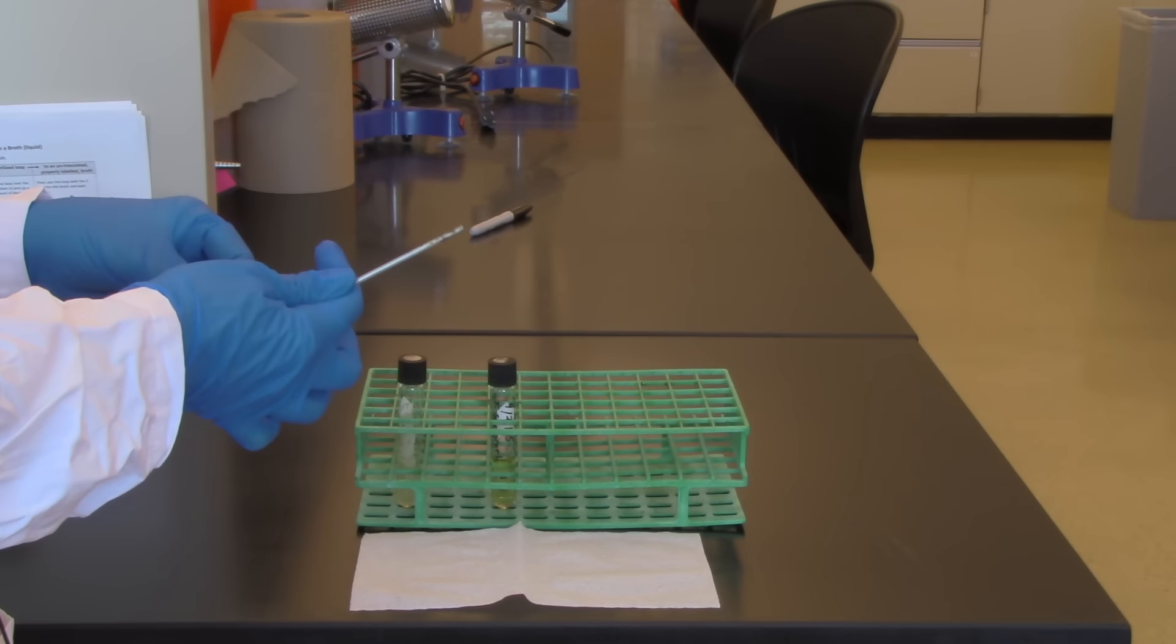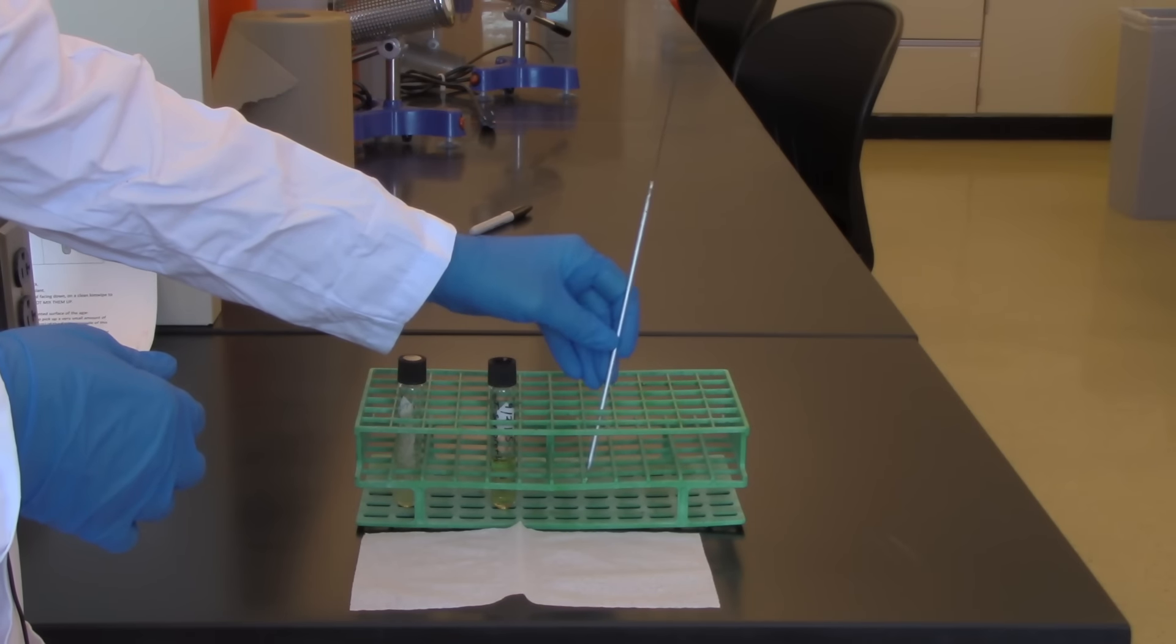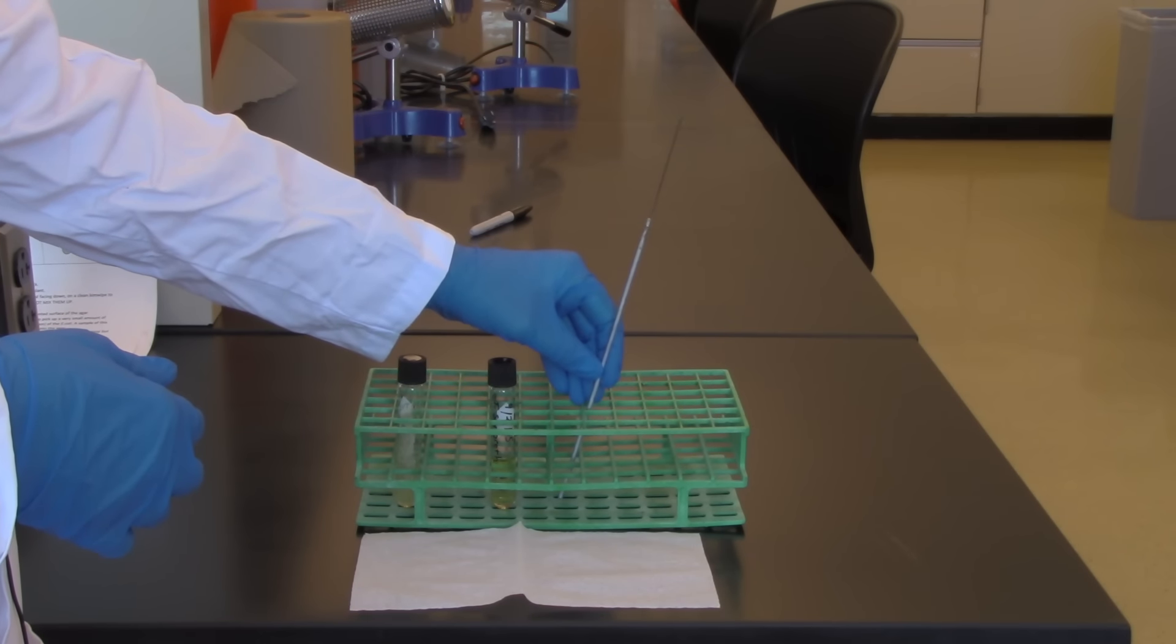And now I will go and sterilize this tool. And that is how you inoculate a liquid broth from a slant.